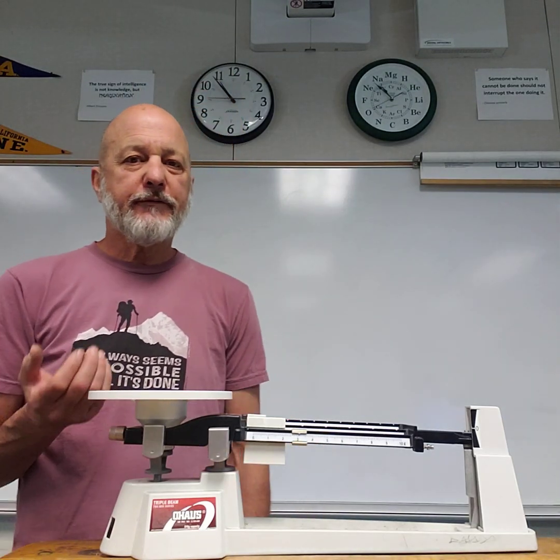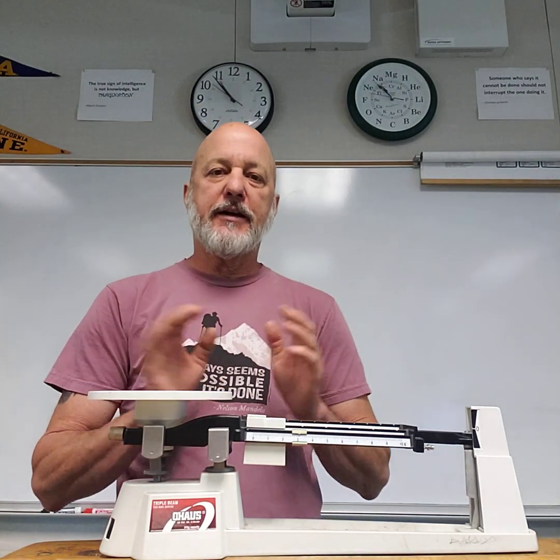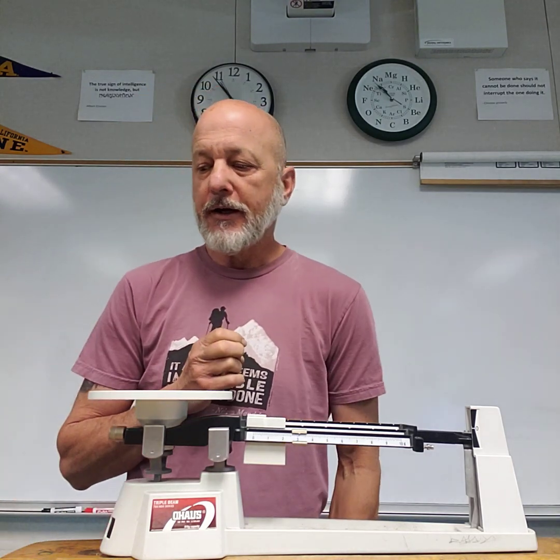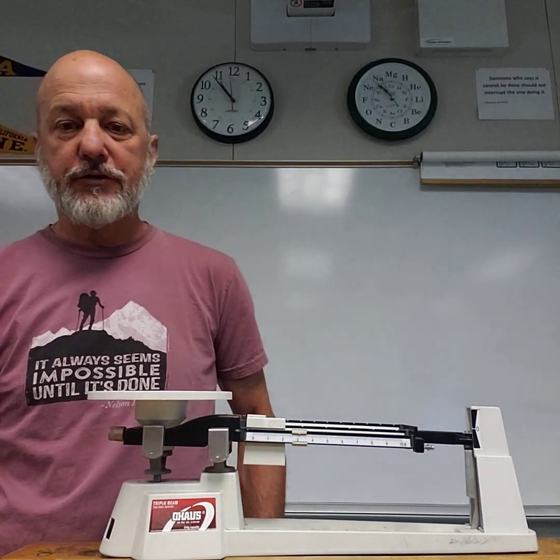Okay, here's just a quick video for parts 3 and 4, just a couple of pointers for doing that. Some of you may have already completed that and got it down, but just to help if there's any questions on this part. So part 3, of course, is just dissolving sugar in water.